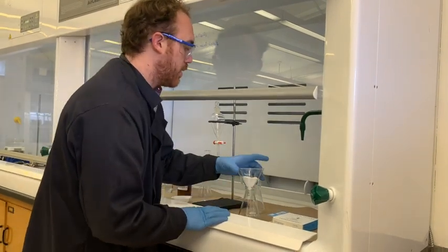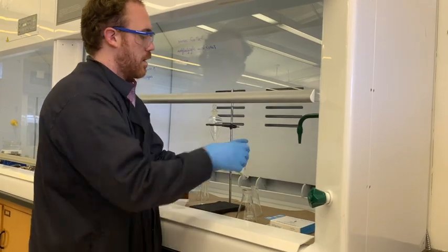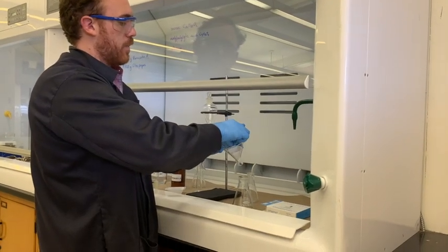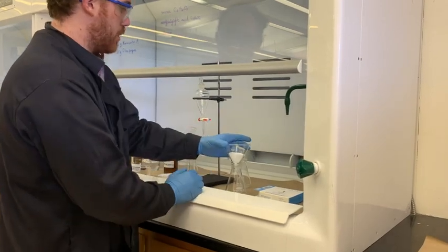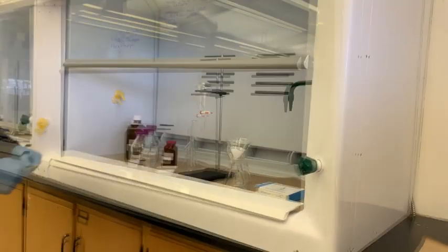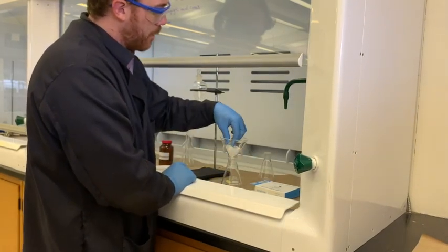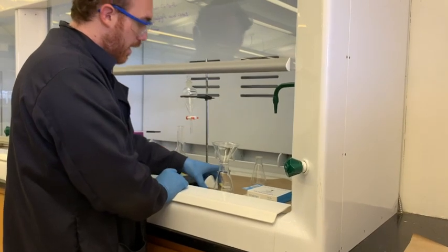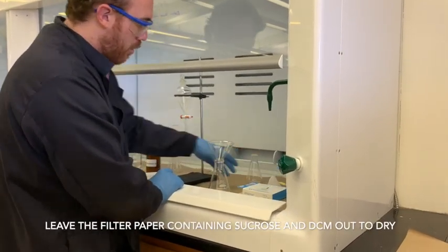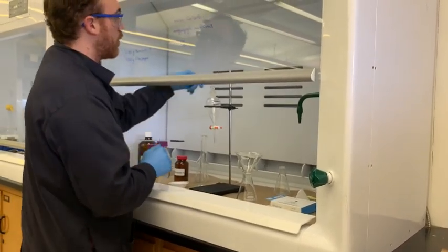This appears to be done filtering, and this will be our sucrose. We'll leave that to dry on a watch glass — just grab a watch glass real quick. You don't want to leave it sitting on the bench top; it's not safe. I'm going to leave this over in the corner so it can evaporate without creating any fumes to breathe.